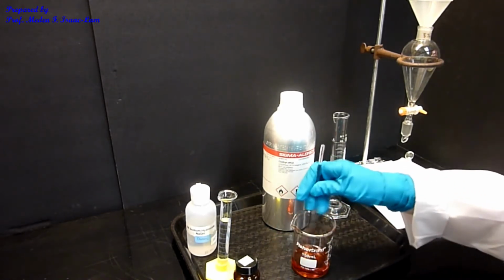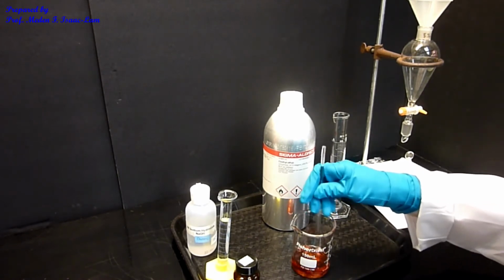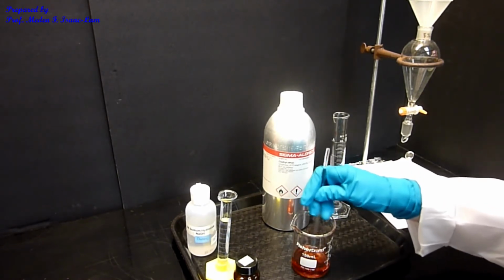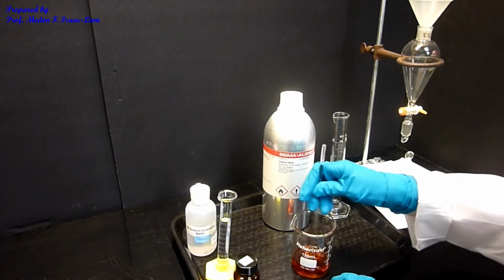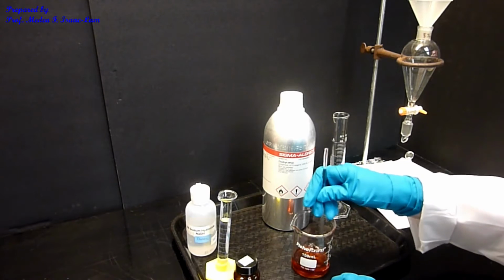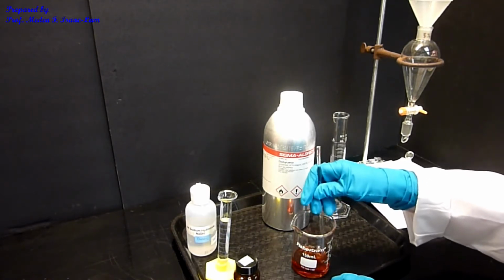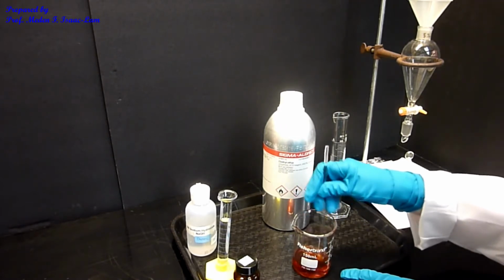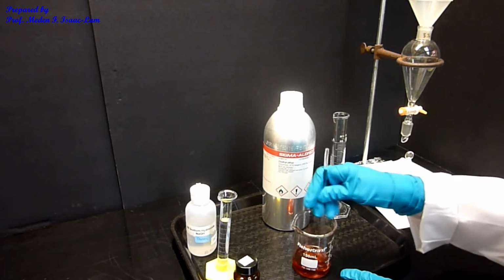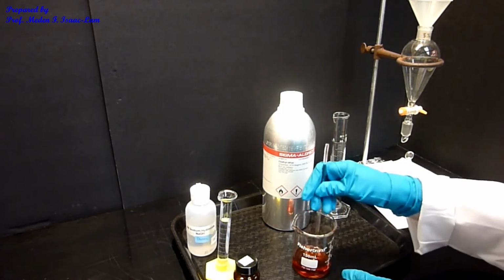So I want to dissolve it, so that when I add the base and extract, I have one layer and I don't have any particles floating. In the mixture, there's a solid component. That's why you see the solid particles. And it's also colored. So the three components, I have everything in here with the ether.